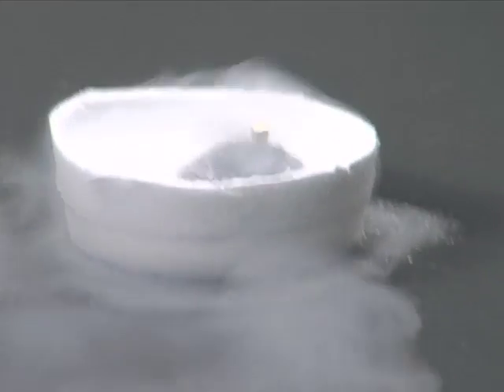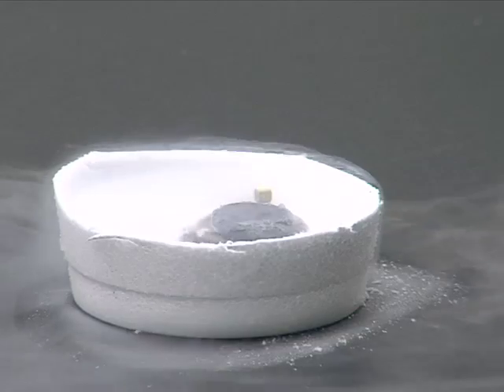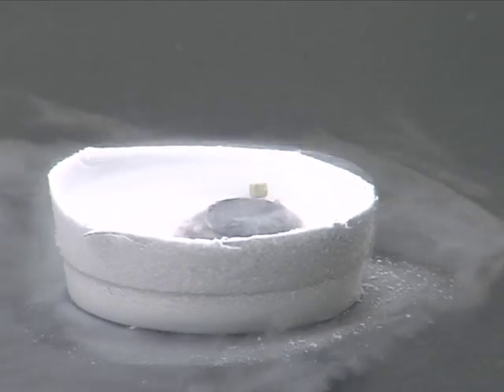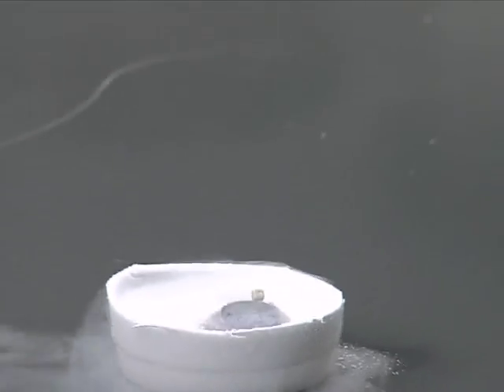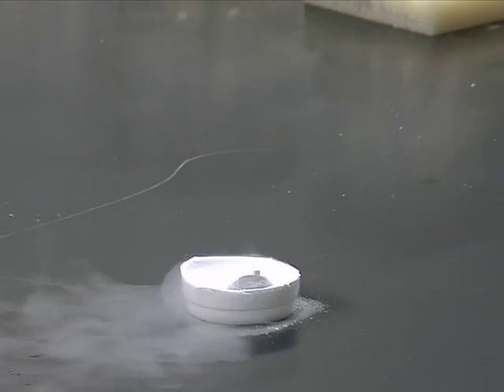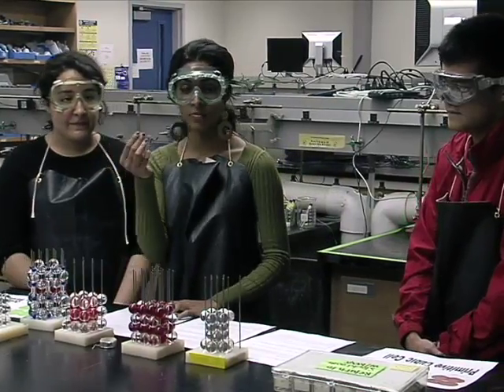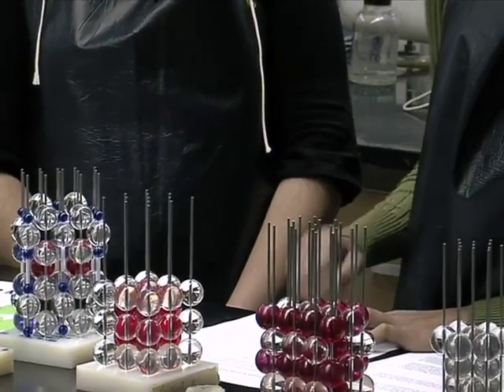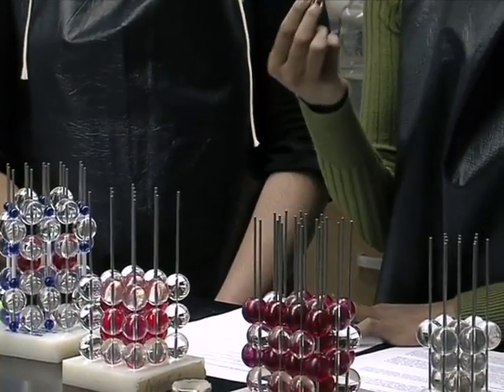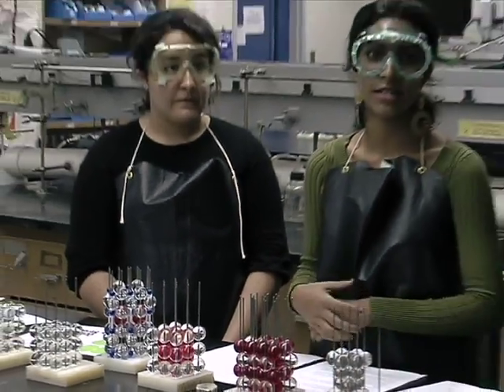We will place a magnet on top of a superconductor that has been cooled by liquid nitrogen. This will induce a current that will then cause the magnet to repel and levitate. The memory and acoustic properties of nitinol will then be observed and compared to cubic unit cell models of both martensite and austenite, two forms of nitinol. The austenite form, and this is an austenite rod, will make a characteristic ping sound when it's dropped on a lab bench, and the martensite rod will make a thud sound, a much more muted and less resonant tone.